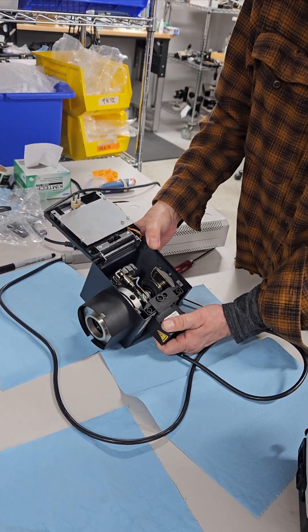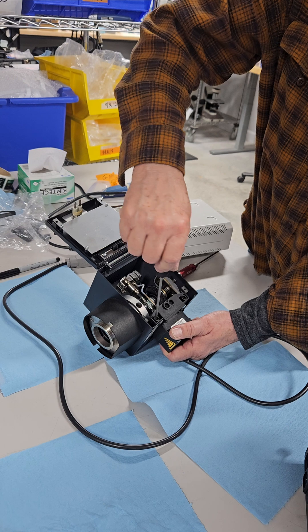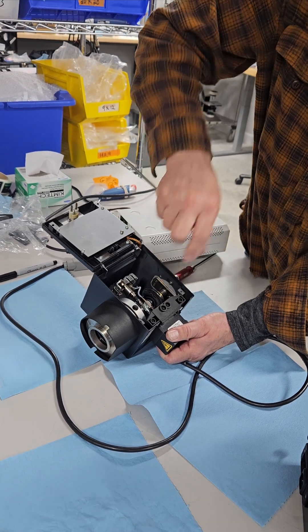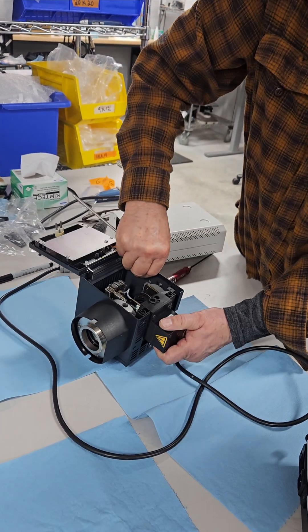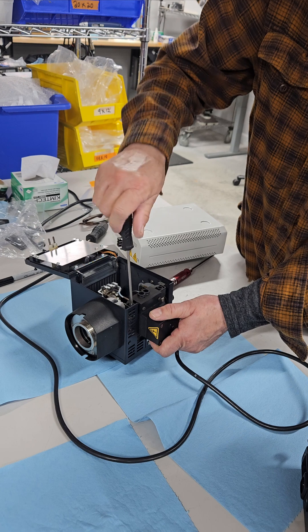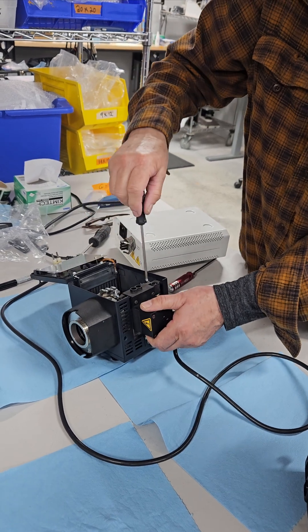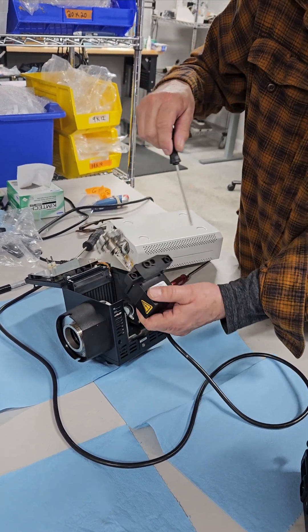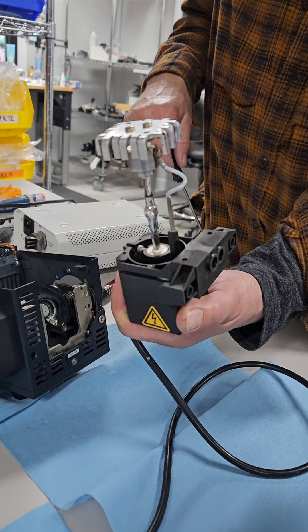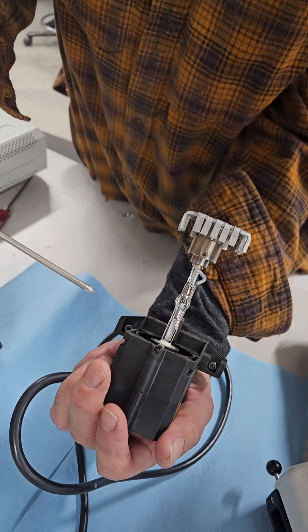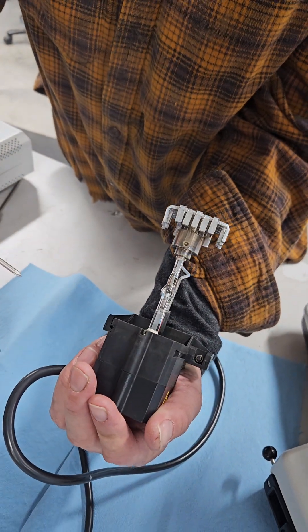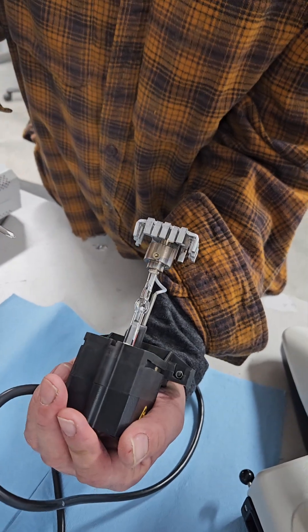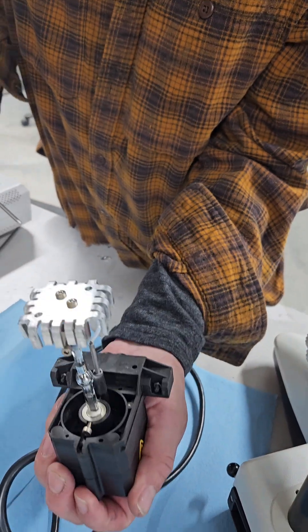It just slides out on a dovetail on a good day. That holds the bottom of your mercury lamp in. Looks like maybe a 2.5. That's it.